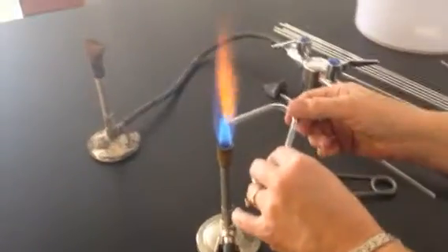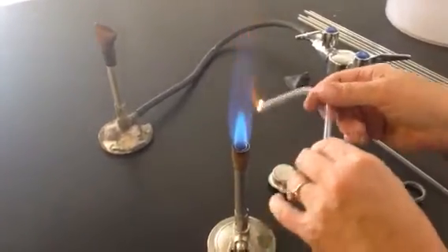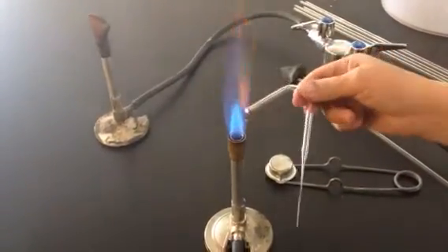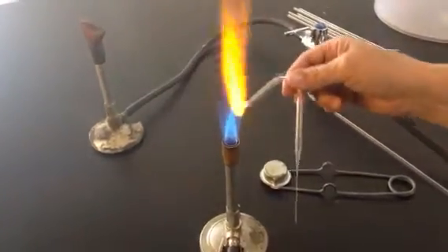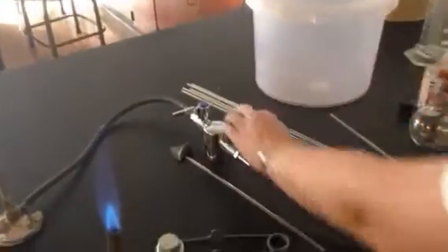And you really put the end that was broken, that has some sharp edges, into the heat. And this has a little rubber stopper on it that's burning. Yours won't burn, I hope, because you'll have a fresh piece. And you kind of fire polish that edge until it doesn't have any sharp edges. And then you're going to, again, put that down so it cools.